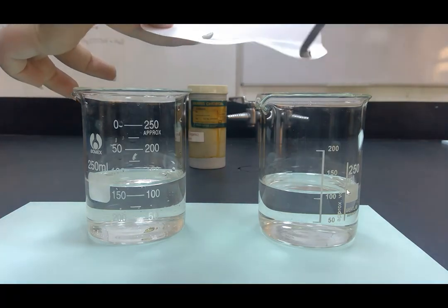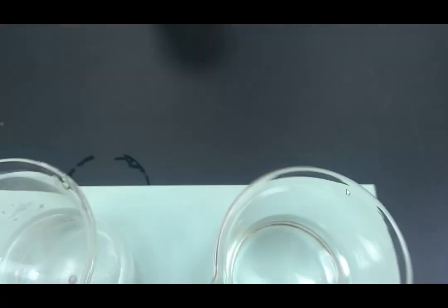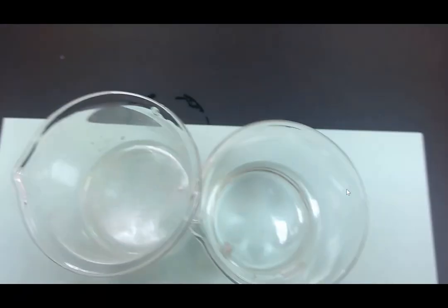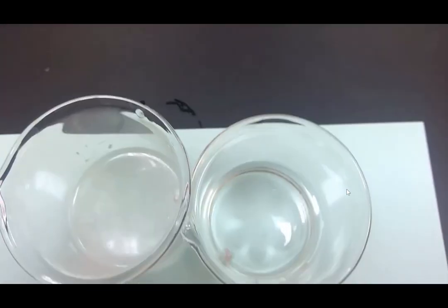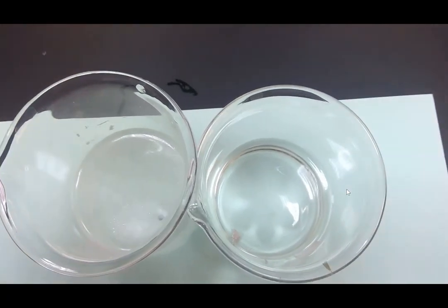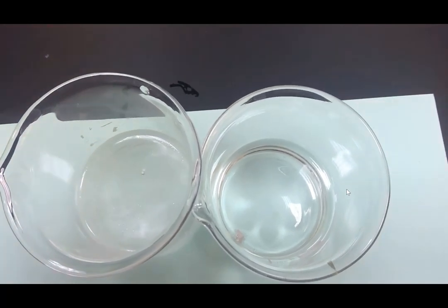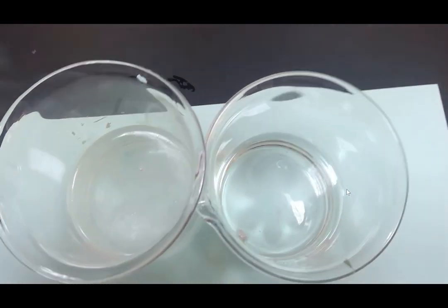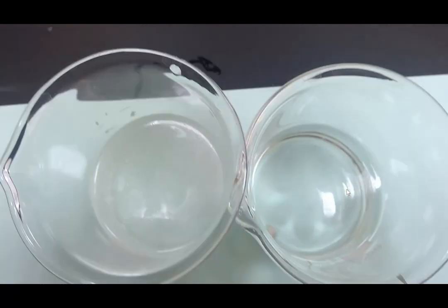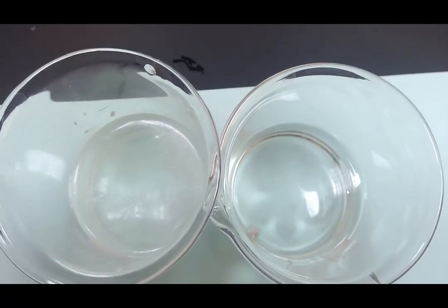So into the ethanol and into the water go my 2 pieces of sodium. We can see straight away that the sodium in water is fizzing very rapidly, as we have seen before. It's racing across the surface of the water in a ball on the left, whereas with an alcohol, you can see the reaction of sodium with alcohol on the right. There is bubbling happening, but it's not very vigorous. There are bubbles of hydrogen being produced, but it's not a particularly vigorous reaction.